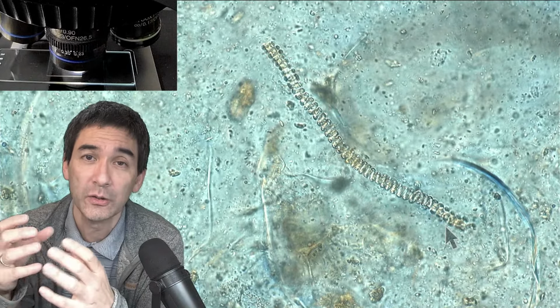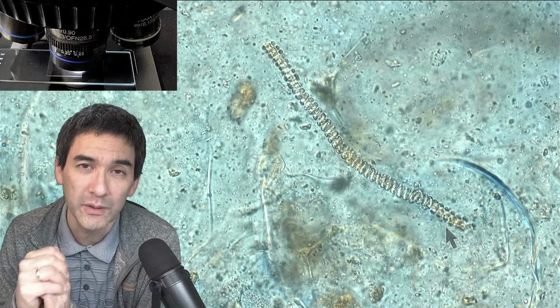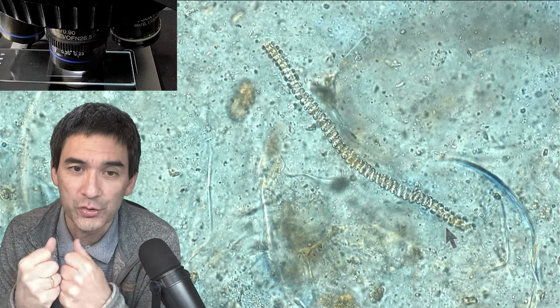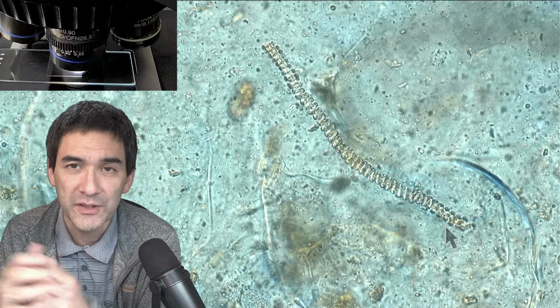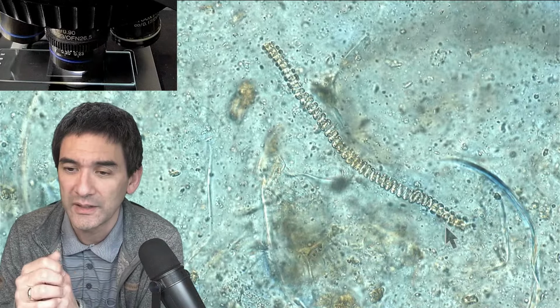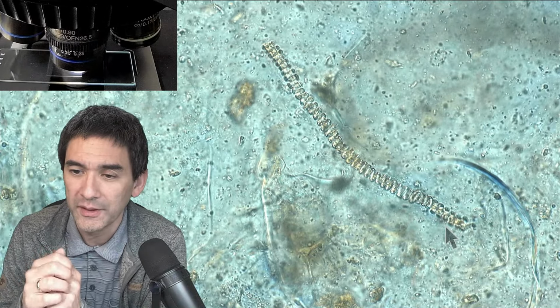Why specifically those? Because these xylem tissues are quite strong, because they're not only there to transport water, but they also give quite a lot of structural strength to the plant. They're lignified, as we call it. Lignin is wood, right? And so they are indeed physically also stronger. Therefore, they don't break down as quickly, and that's why we can see them quite nicely. Yeah. Good point. Good point. Okay.